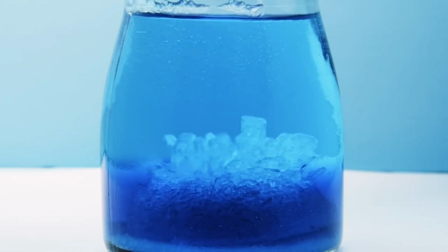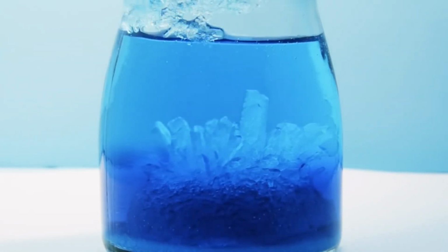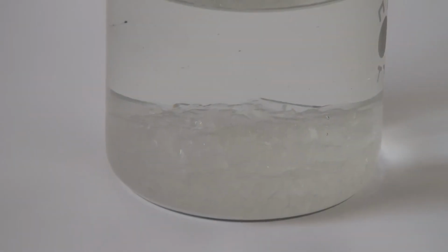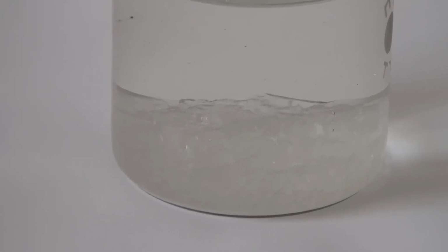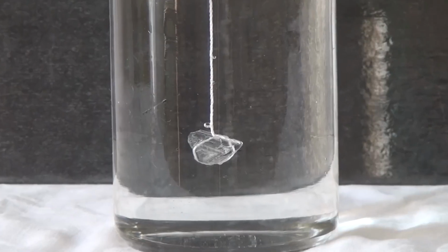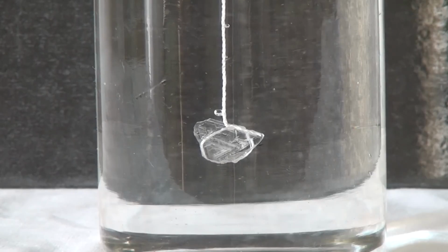Crystals form as a result of the change in solubility of salts in the water when the temperature changes. Excess salt, which cannot be dissolved in the solution, falls to the bottom of the cup. After a day, we may notice that beautiful crystals have formed at the bottom of the beaker. These crystals will be used as seeds. A seed is a small crystal that is immersed into the solution, which will continue to grow new layers of crystal on top of it.